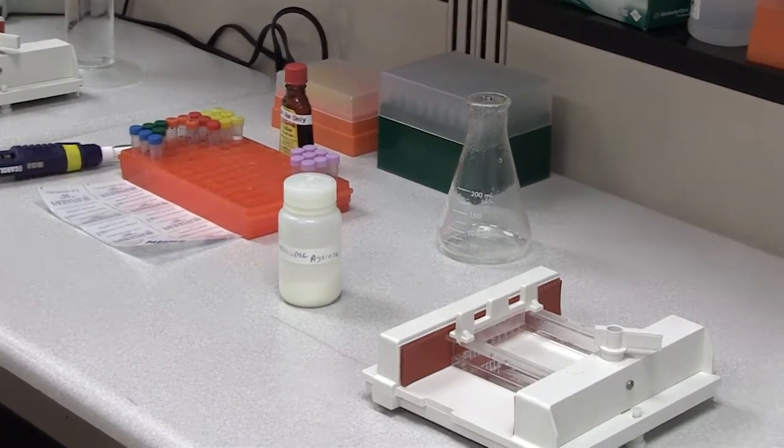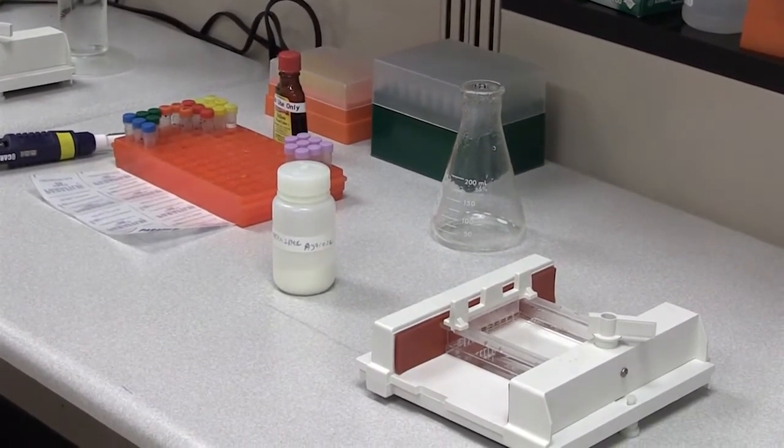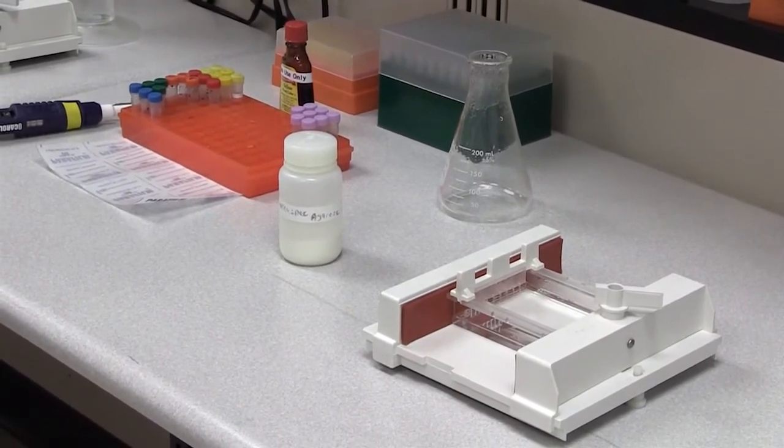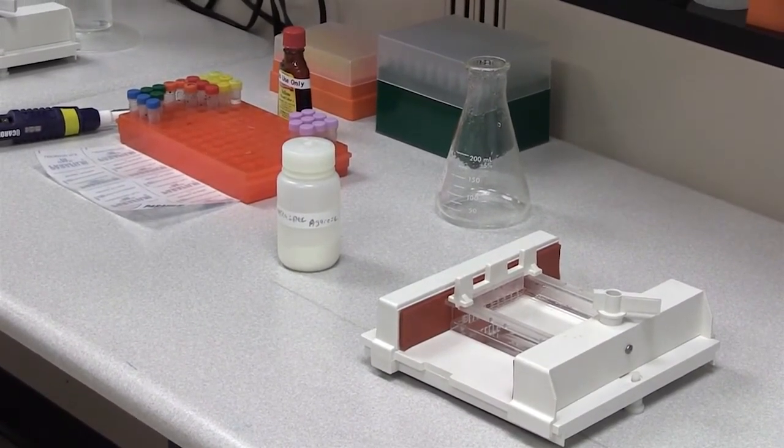Now what we're going to have to do is not disturb the tray. The agarose has to sit and firm up before we can load it, so we're going to let that sit for about 20 minutes.